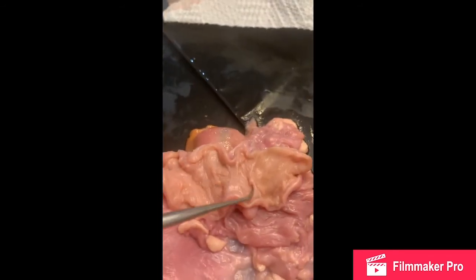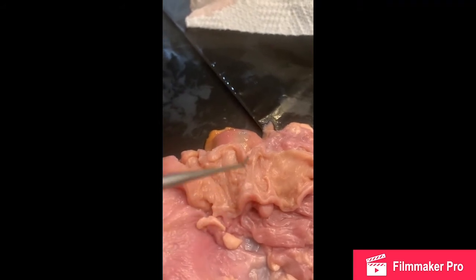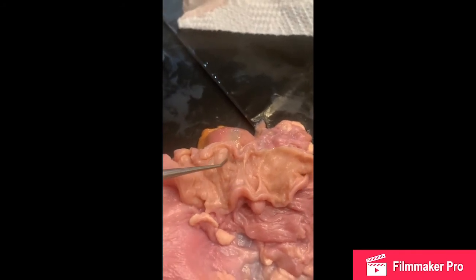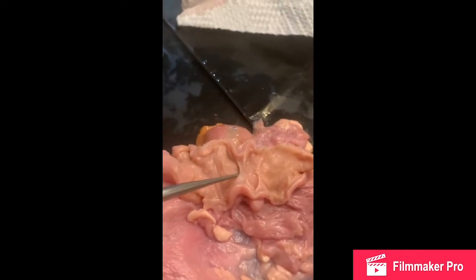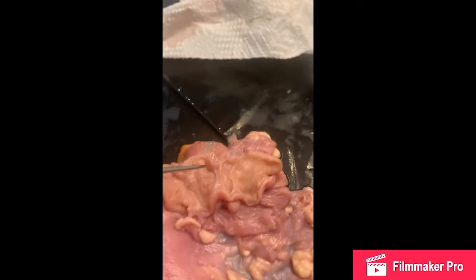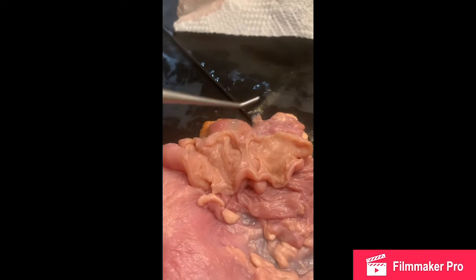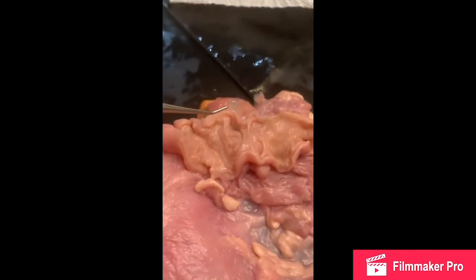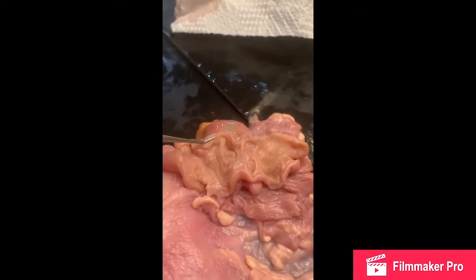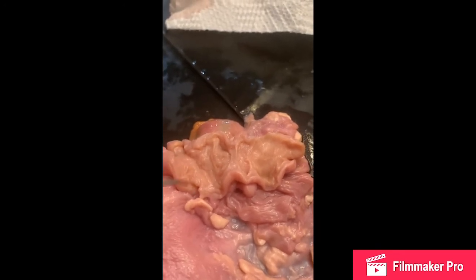In cutting open the uterine horn, we can kind of see here the tubular layers that connected the uterine horn together in this case. So we can see those here and there. Just so we know, our muscularis tissues are going to be important for contractions in our uterus. So these here help control contractions within our reproductive system.